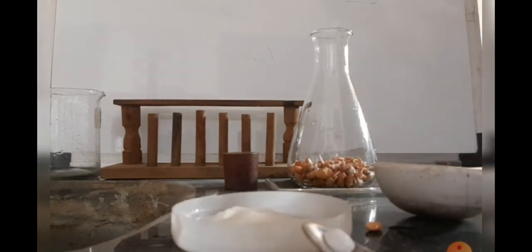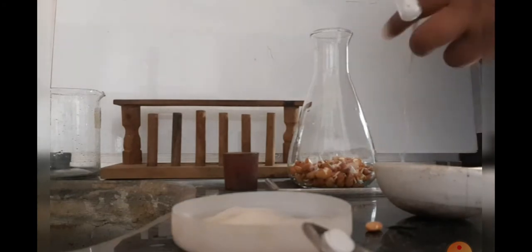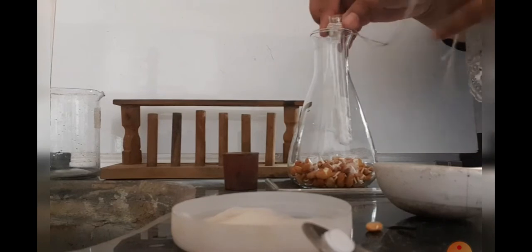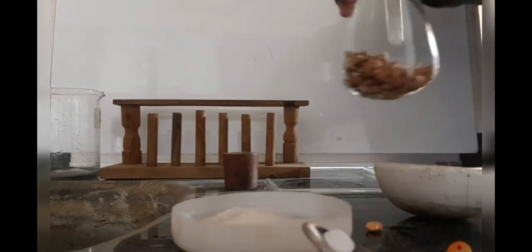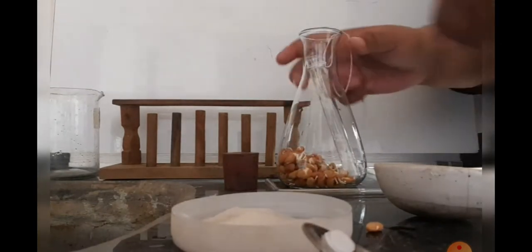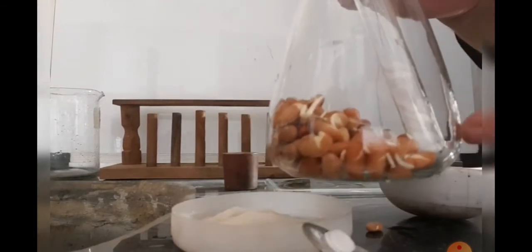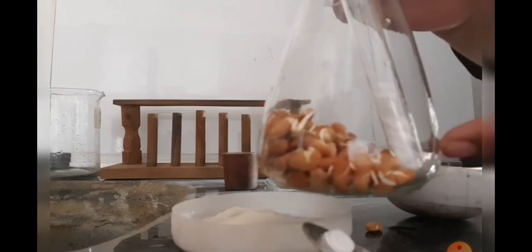We have to place the test tube in the conical flask where we already placed those sprouted beans. We have to carefully place the test tube in the conical flask in this way — the mouth of the test tube is open. Inside the conical flask there are sprouted beans, and inside the test tube there are potassium hydroxide pellets.